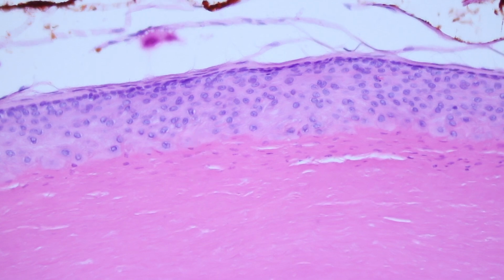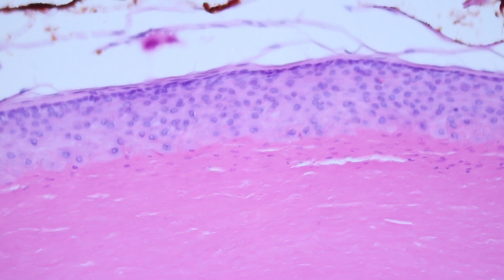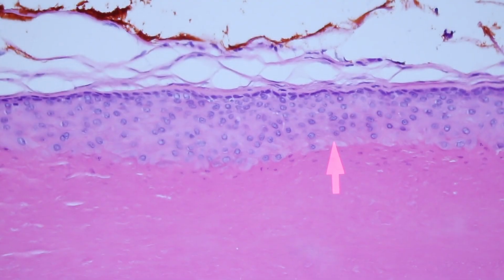But the most important differences are at the center of the cyst, or I guess what's analogous to the top of the epidermis. When you get up here, normally you would have a granular layer. There's no granular layer, or very little. These can have a little bit of granules, but not much. So the granular layer is relatively absent here. And instead of loose, flaky keratin that you're getting in the center of the cyst, you have dense, smooth, homogenized keratin that's all packed densely together.